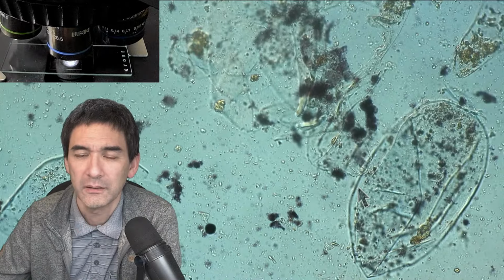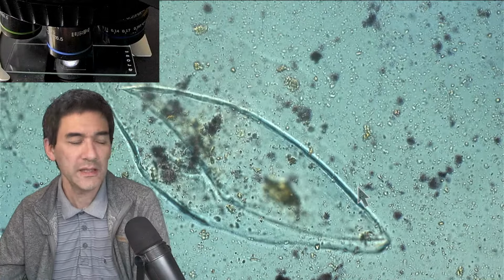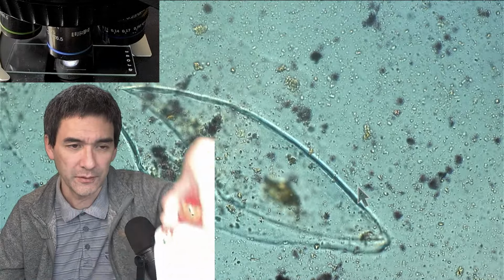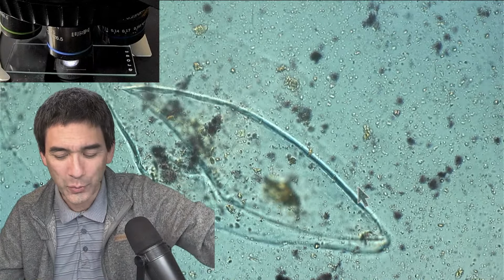So here we go. Okay, that's the same place where we've been already before. Here's another cell. So in any case, this seems, yeah. Now we've also put some of this stuff here. Here it is. So I'm going to have to eat this now, because I don't want any food waste.